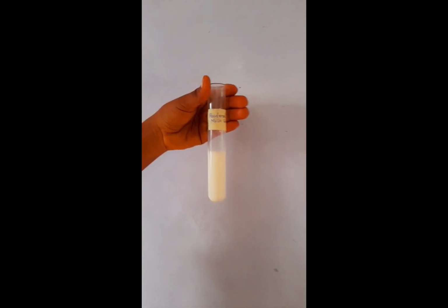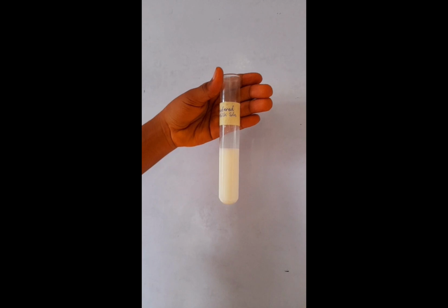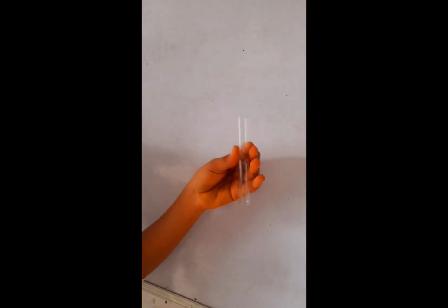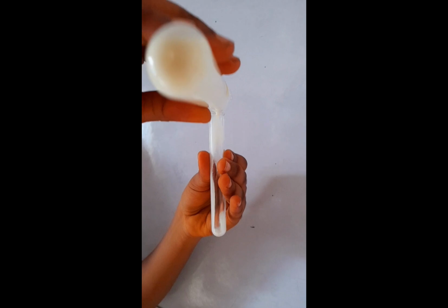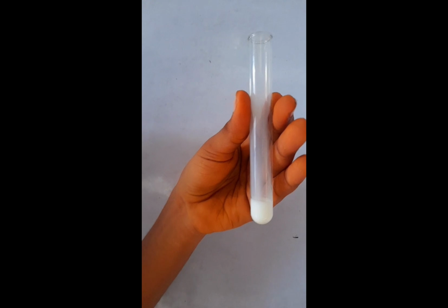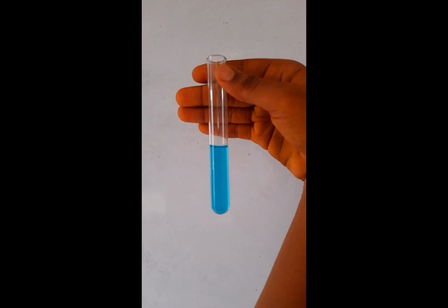So for the last one, D, as in 2A, we were asked to put D in water. So D plus water, and then we stir it. You can see that a white or creamy colloidal solution is formed. Now we're going to divide the solution into 2 portions, but we'll just take a little out of it to use as the first portion. Now we are going to add copper sulfate to the first portion.